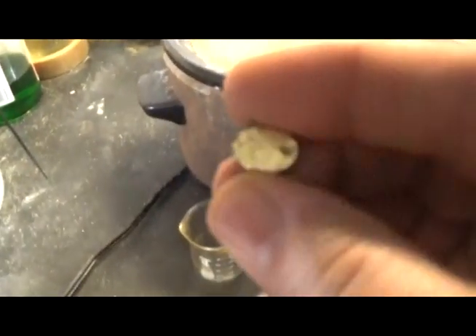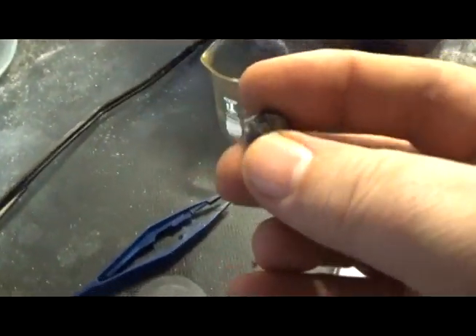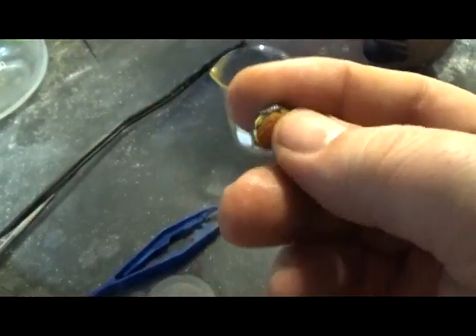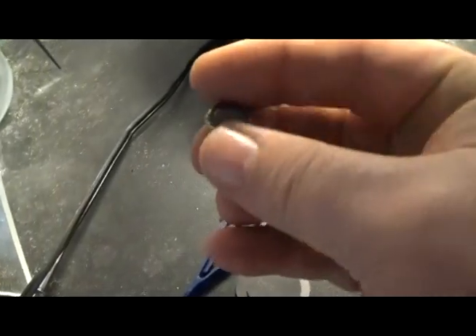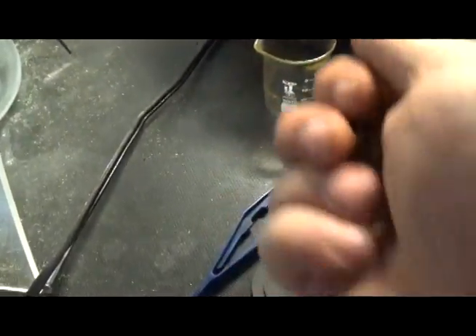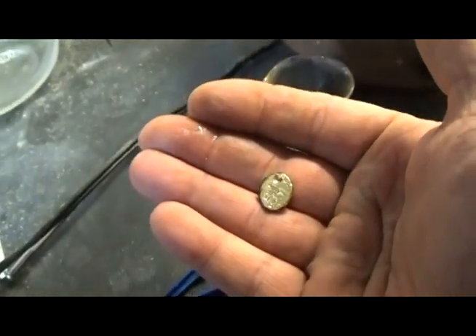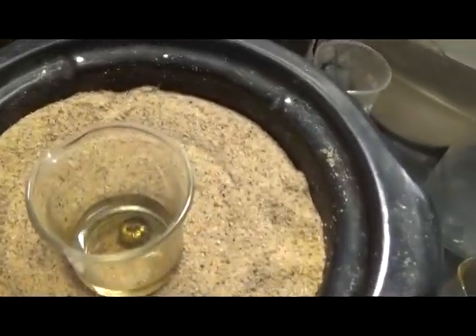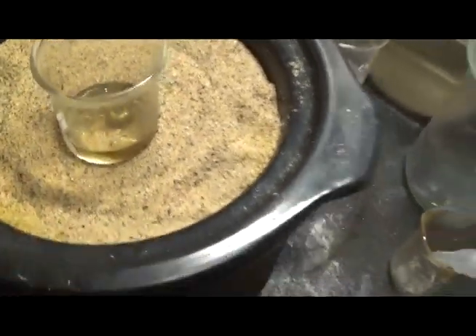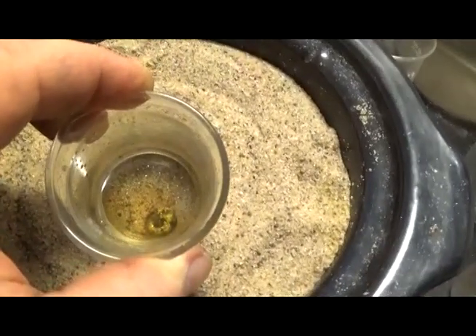We're going to put it in some sulfuric acid to clean it off. We do have some flux on the top of it. It didn't look like it wanted to beat out. So, let's get this cleaned up. Very nice button. And then we'll weigh it out. We didn't even have to really get it hot. It's already doing its thing, cleaning off all that flux and crud off of it.